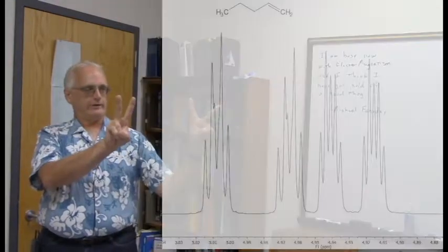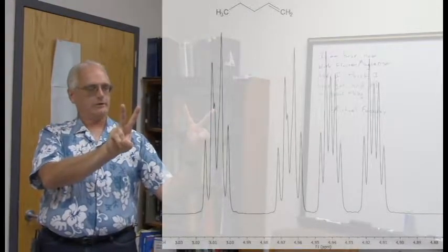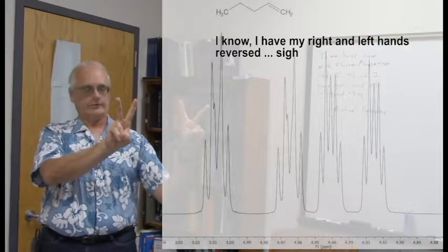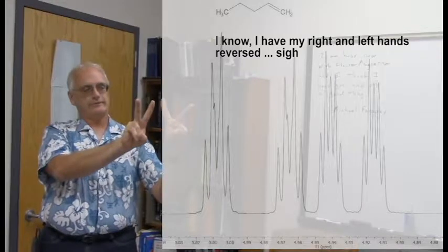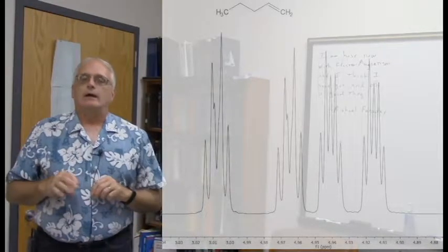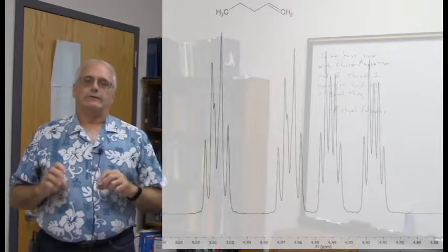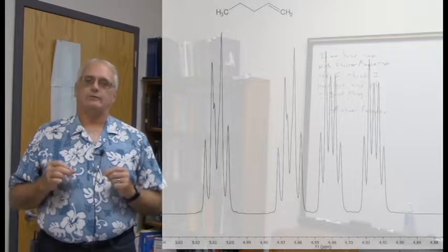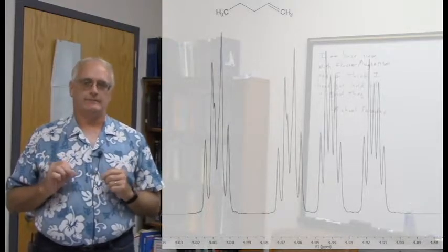I was doing this business a moment ago. There's the trans with the big coupling constant. There's the cis with a large but smaller than the trans coupling constant. They're closer together now. They've kind of moved in something like this. When we look at that area of the terminal alkene, I've had some students look at this thing and say, oh, that kind of looks like a doublet of doublets.